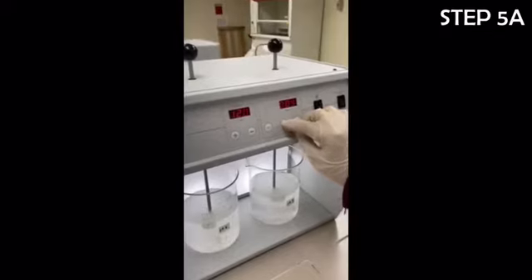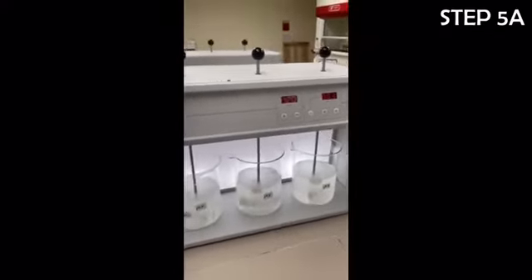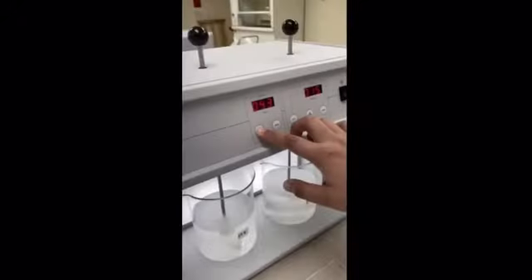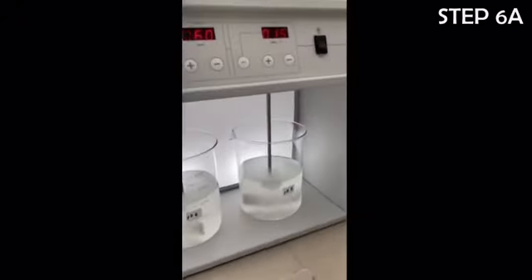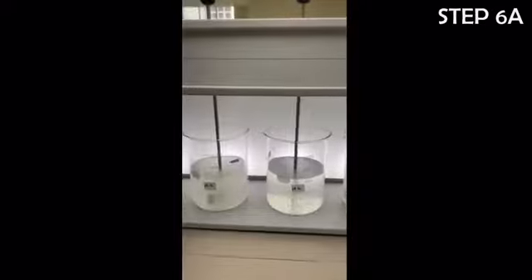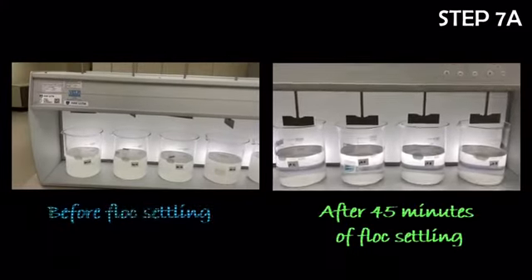Then, the stirrers were turned on. The mixtures were rapidly stirred at 120 revolutions per minute for 3 minutes. After 3 minutes, the stirrer's speed was reduced to 60 revolutions per minute for 15 minutes, at slow mixing. Fifteen minutes later, the stirrers were turned off, and the settling of flocs was allowed to occur for 45 minutes.